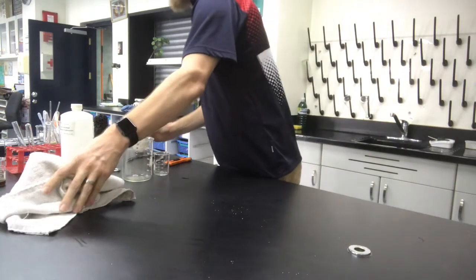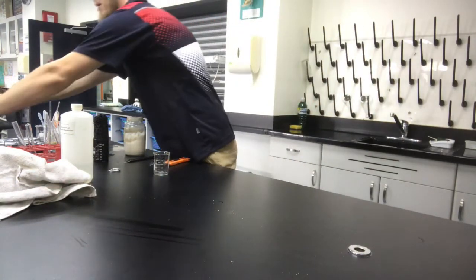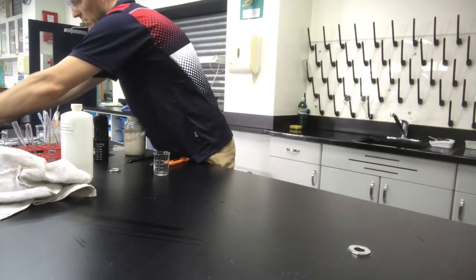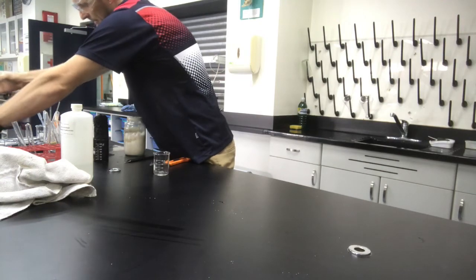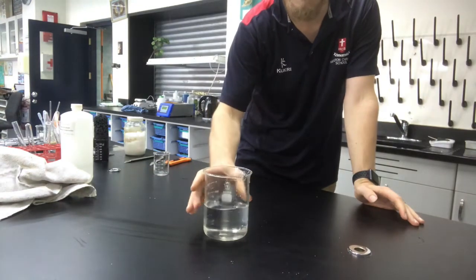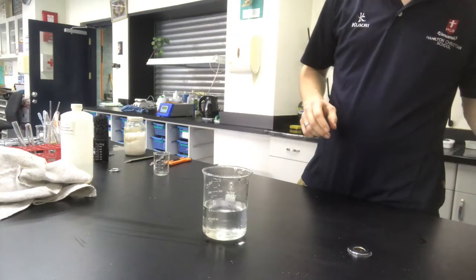What I'm going to do, right, move that out of the way, is I'm going to react some sodium. Okay, so some potassium metal, actually, I believe it is. Okay, so I got water.